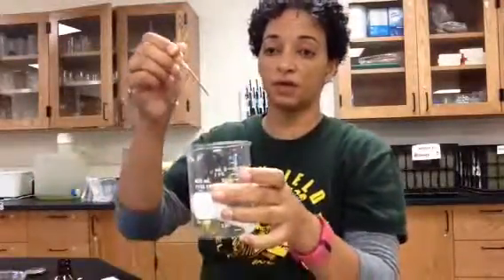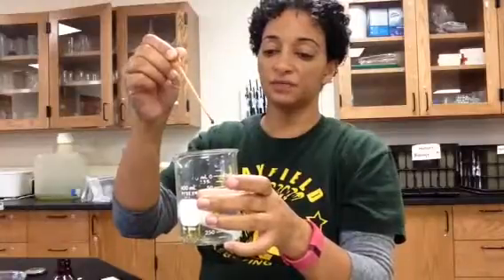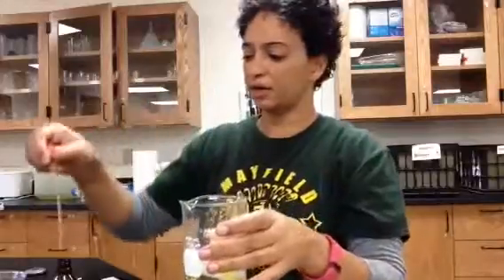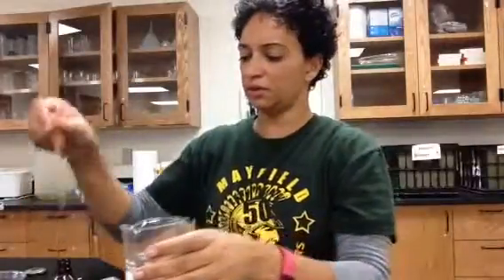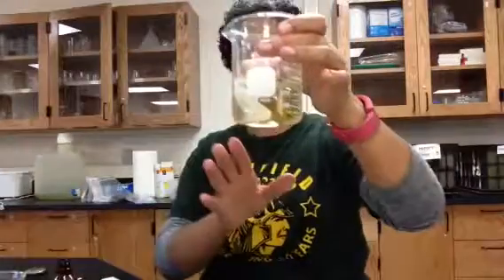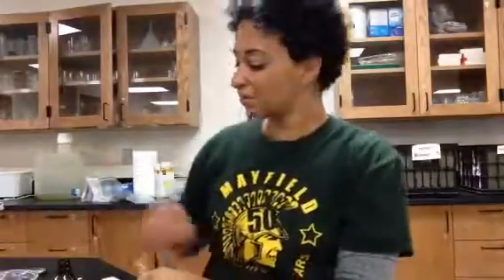I want to make sure to test the water for glucose before I put the iodine in, because iodine sometimes messes up the glucose test strip. I now have iodine in my beaker and my model cell submerged in it. I'm going to let that sit for about 30 minutes. When I come back, I will test both inside the tube and inside the beaker for glucose, and I should be able to figure out whether starch or iodine moves through the tubing based on color changes.